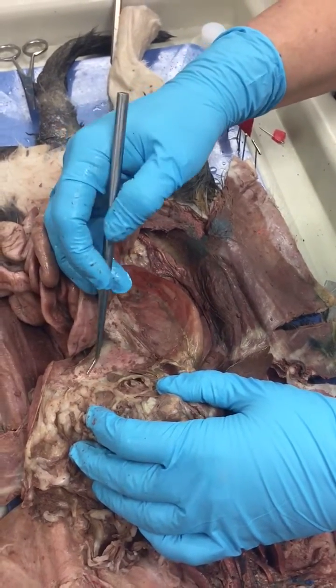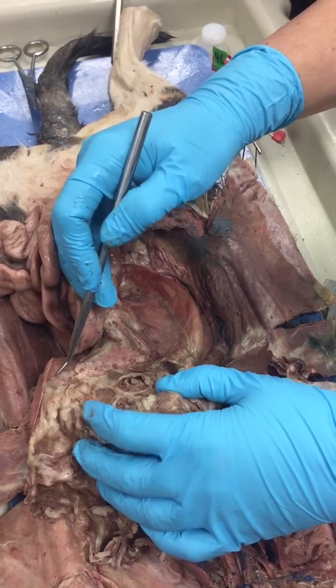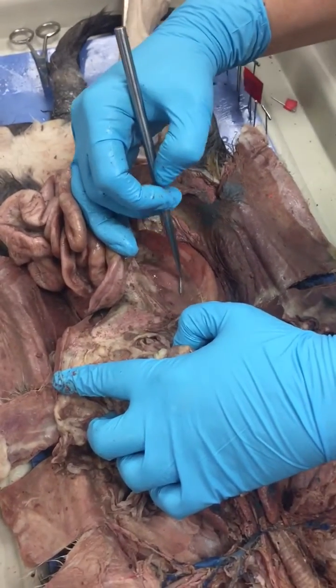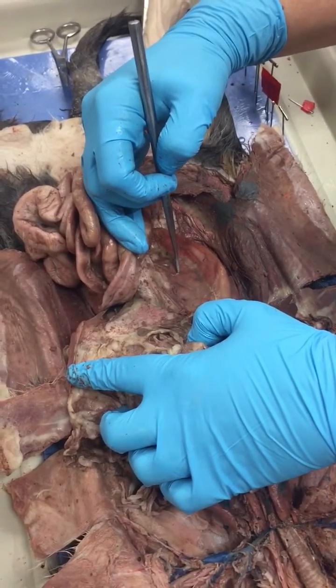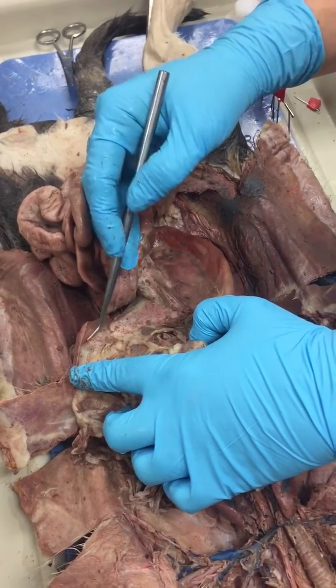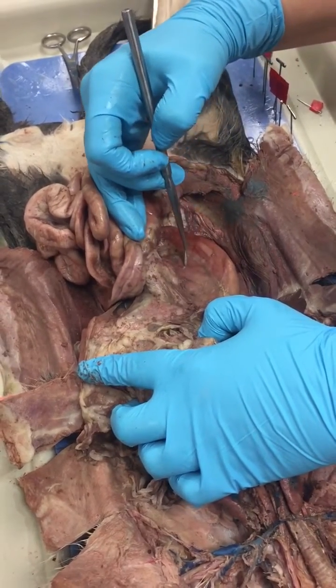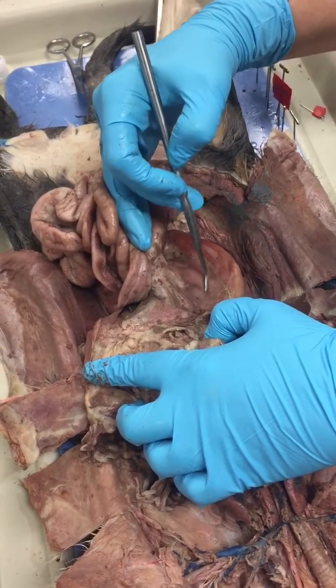Under the stomach and the liver, do you see this light pink area? All of this is your pancreas. So pancreas, Sydney, do you see this? Pink, pink, pink, all of this is your pancreas.